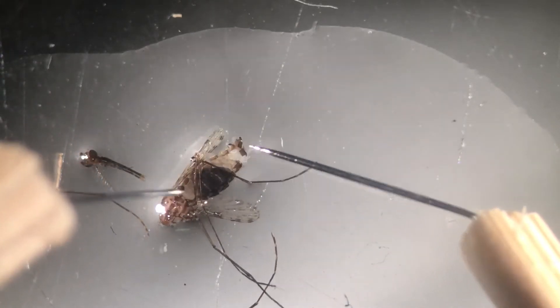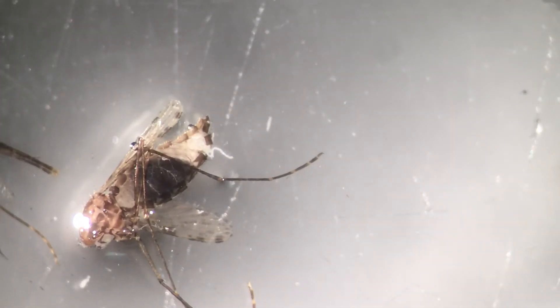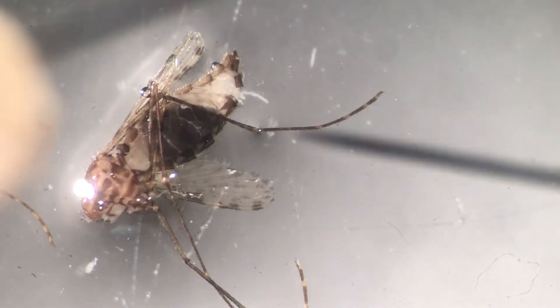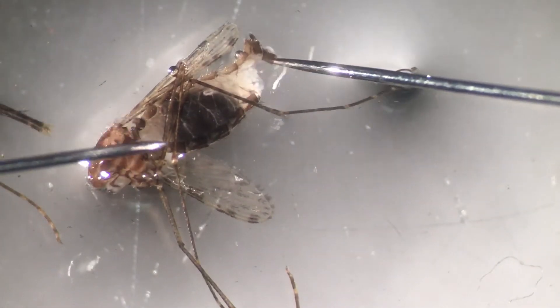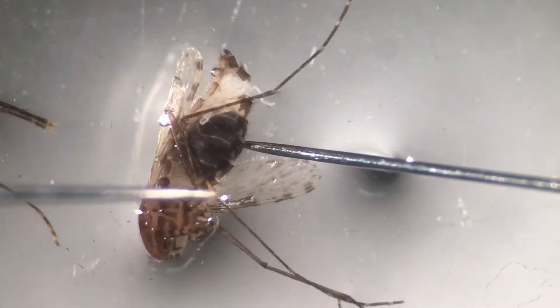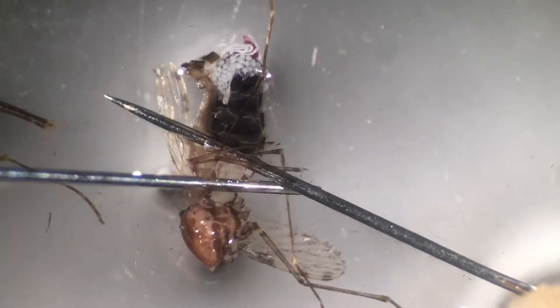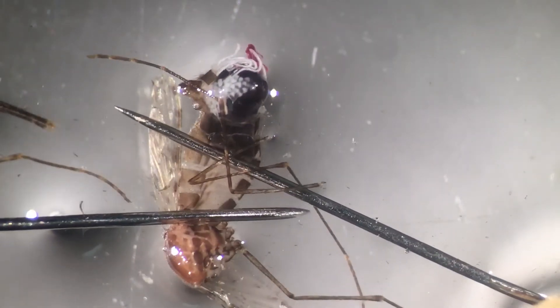You can see that's exposing a bit of the eggs. Let me show you - let's get closer to have a nice look at the organs. Here we have some of the eggs that are starting to develop. What we're going to do now is push the contents of the gut out.